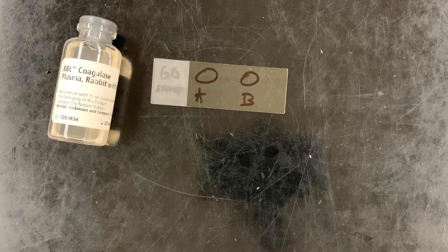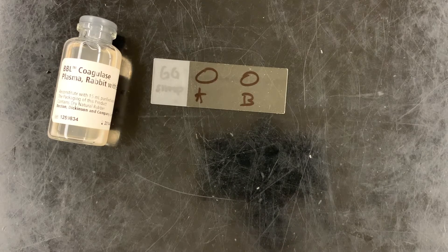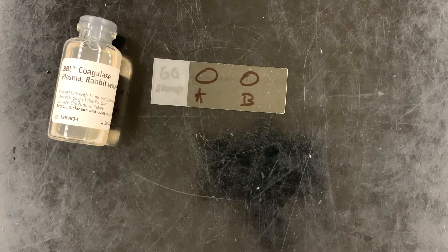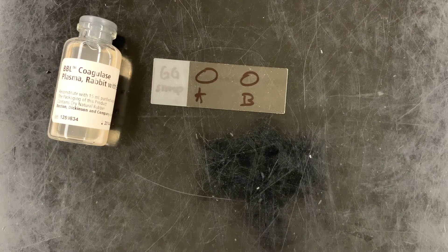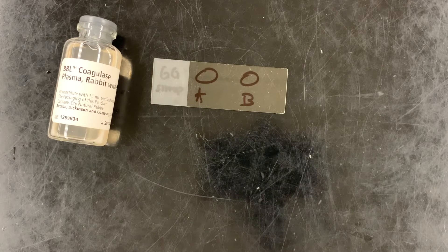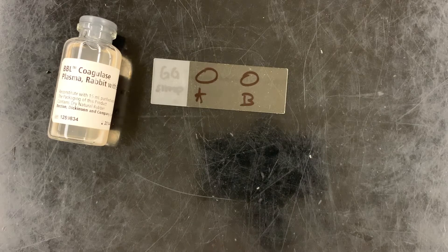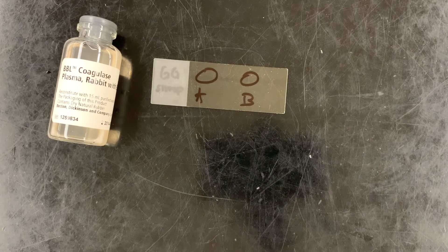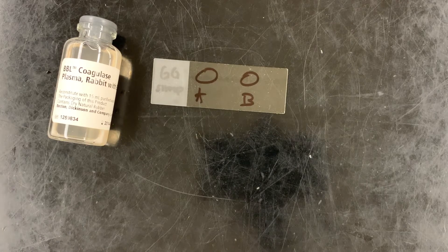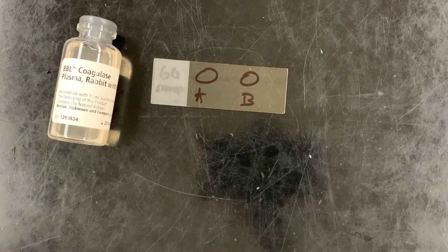Don't forget, work has already been done. I know through microscope analysis that this is a gram-positive coccus, and using my catalase test I've confirmed that this is some sort of gram-positive Staphylococcus. So now I really want to determine: is this potentially pathogenic Staphylococcus aureus, or is this some other Staphylococcus?